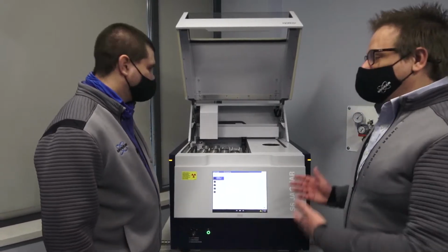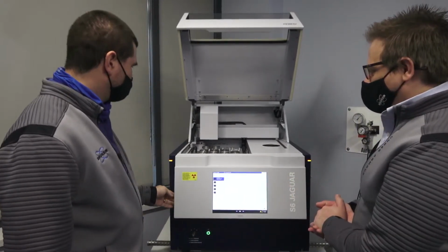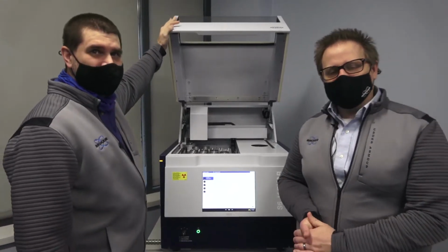Well, thanks for showing us the instrument. Yeah, no problem. We're going to head back over to the studio, and we're going to answer some questions.